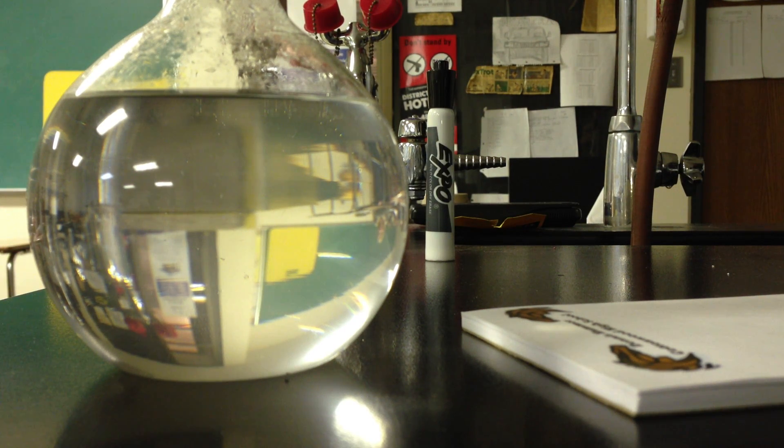So what type of solution do I have? Yeah, supersaturated now. And so of course you guys know that supersaturated solutions are pretty unstable. In that, when you add a seed crystal, they'll kick back out to their saturated state, won't they?